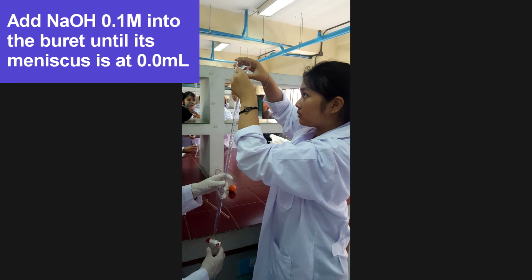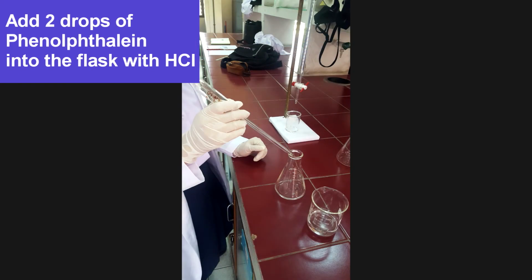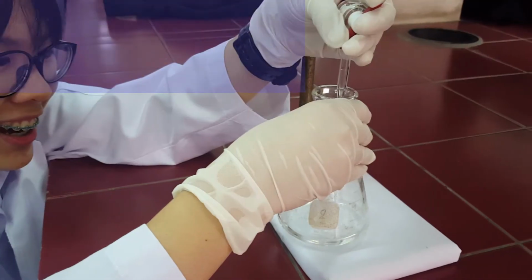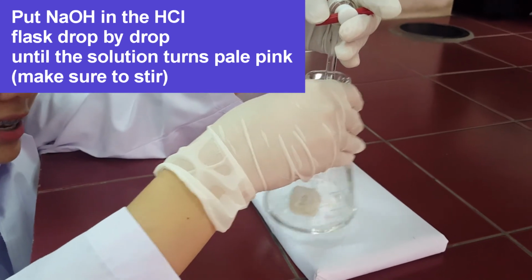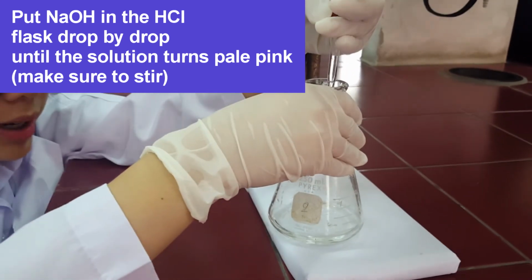Add 0.1 molar concentration of NaOH into the burette at 0 milliliters. Add 2 drops of phenolphthalein into the flask with HCl. Put NaOH into the flask drop by drop until the solution turns pale pink.